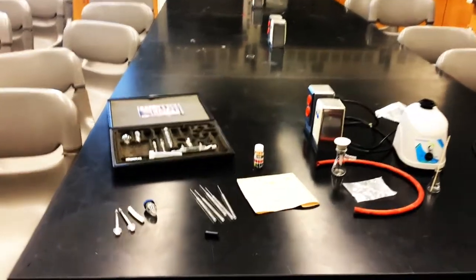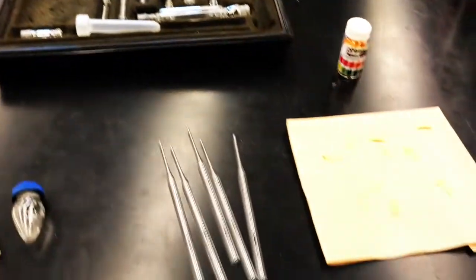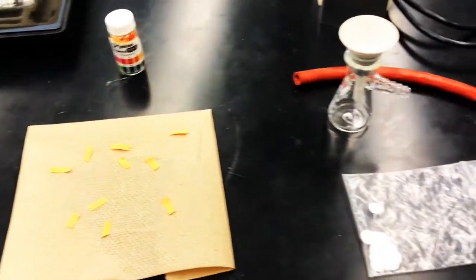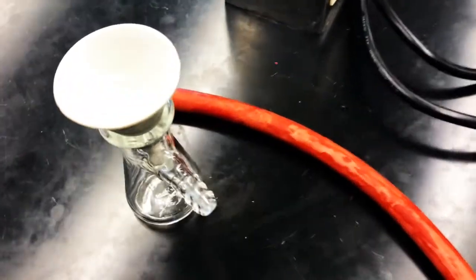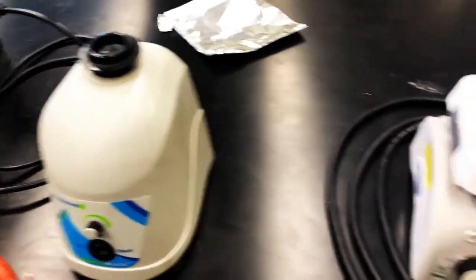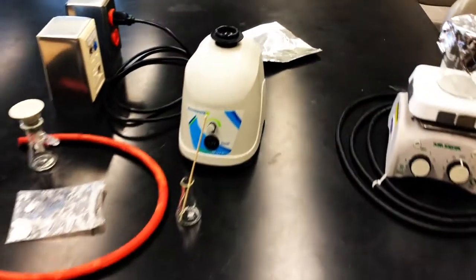Next, we'll take a look at the equipment that we will use in this lab. From the microscale kit, we have a pipette syringe and a pear-shaped flask with cap. We have our Pasteur pipettes, a bunch of pH paper on a paper towel. We have our filter flask with a Hirsch funnel and small filter papers, along with a vacuum tubing. We also have our 10 milliliter Erlenmeyer, and we have a stirring device and then our heating device, so our steam bath.